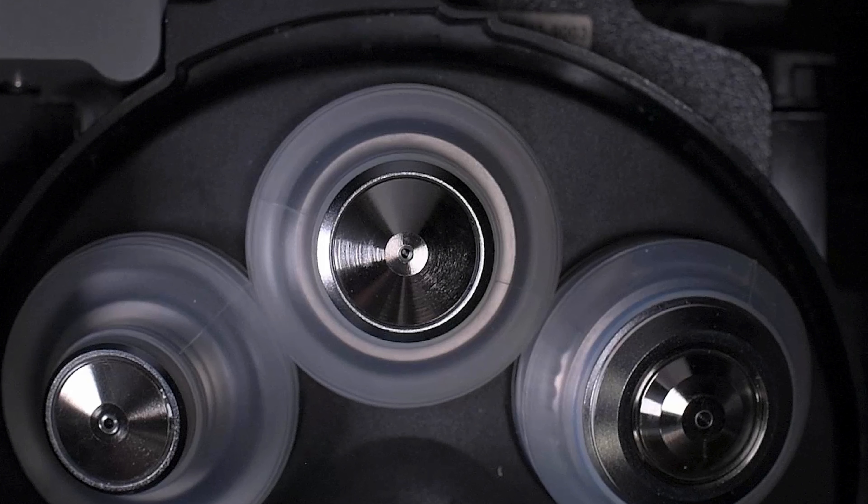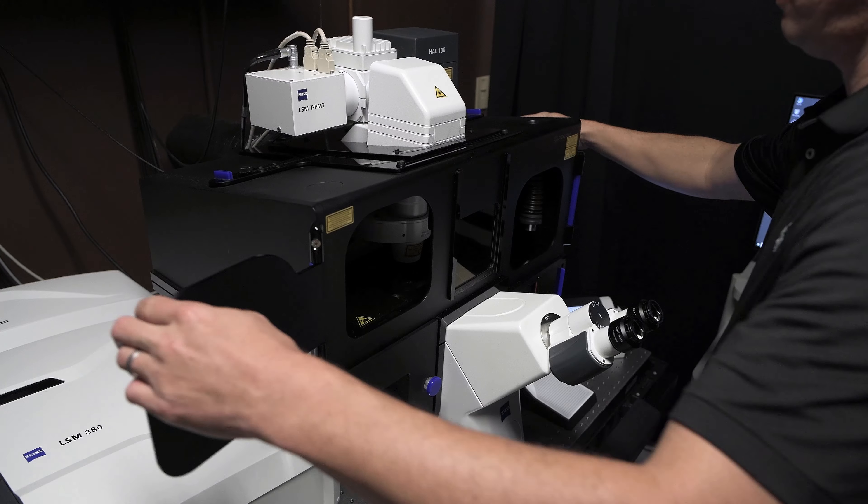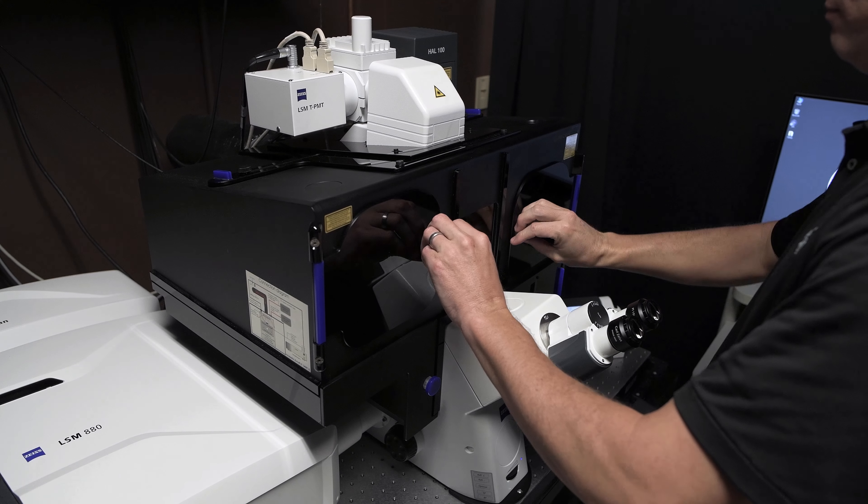Once you have finished wiping up the excess oil, please leave the objective focus in the load position and close up the incubation chamber, as this keeps dust and debris from accumulating on our lenses.